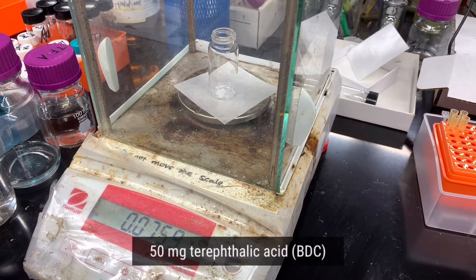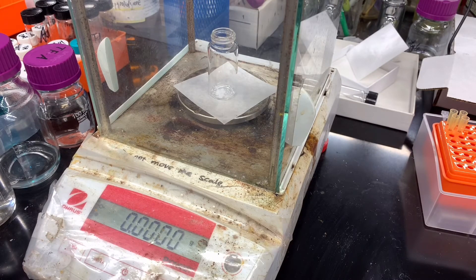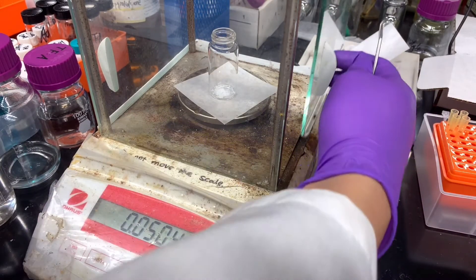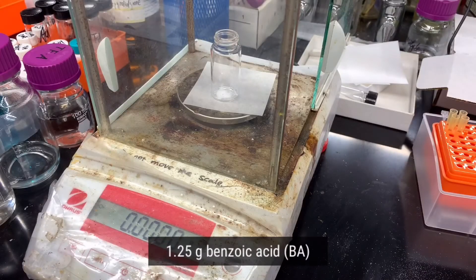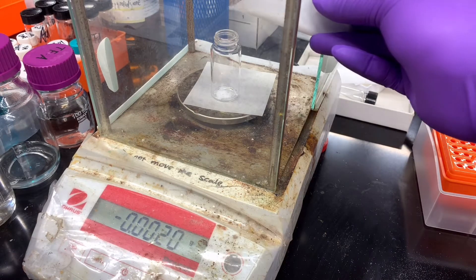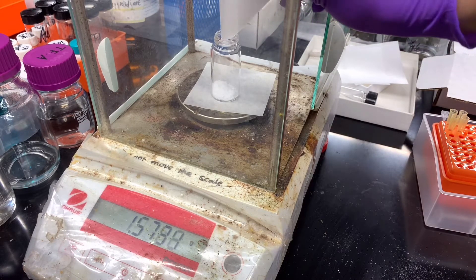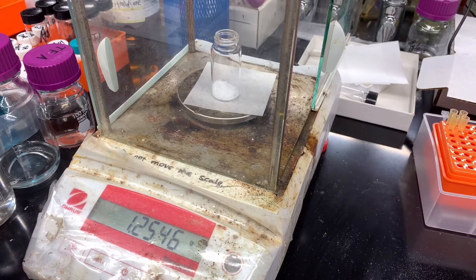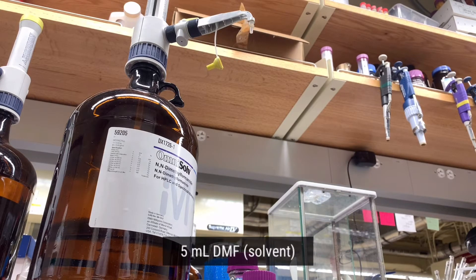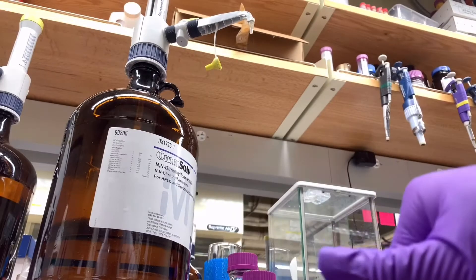Then we need to add 50 mg of terephthalic acid or BDC. Then we need to add 1.25 grams of benzoic acid. Finally, we add 5 milliliters of DMF into the mixture and seal the cap.